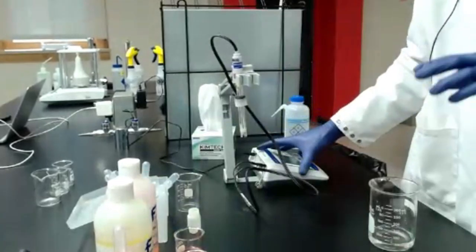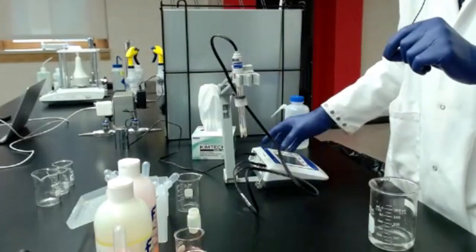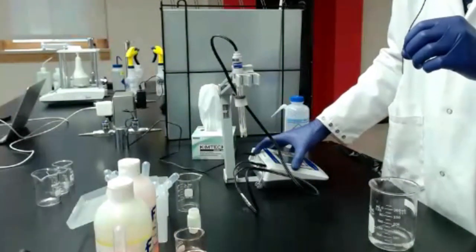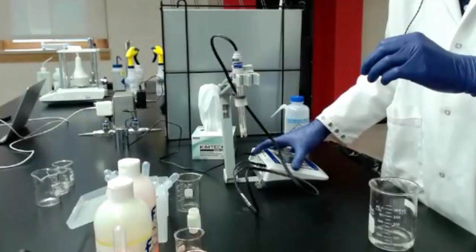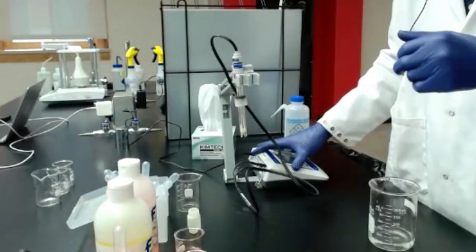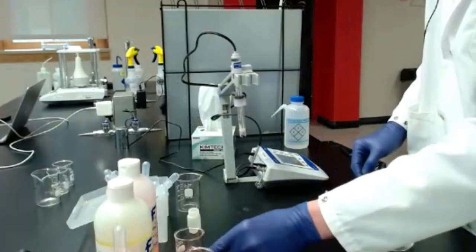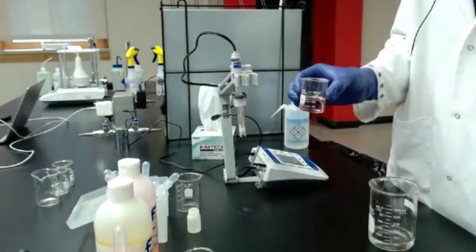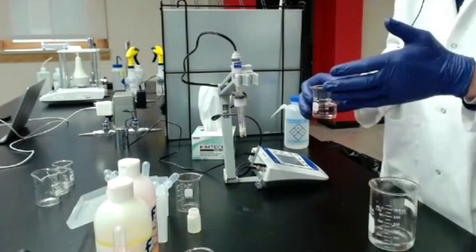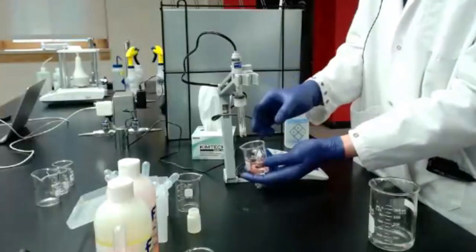So depending on the pH meter that you have, each one operates a little bit differently. Some of them will say standardize. Mine has a little button that has the letters STD on it for standardize. The one in our other lab has CAL for calibrate. So you should be able to just follow the on-screen instructions once you get to the calibration screen. But for this one, I'm going to hit the standardize button, and I'm going to start with my pH 4. Again, some of the instructions will tell you to start with either the lowest pH or they want you to start with pH 7. It does depend. But for this one, I'm going to start with pH 4.